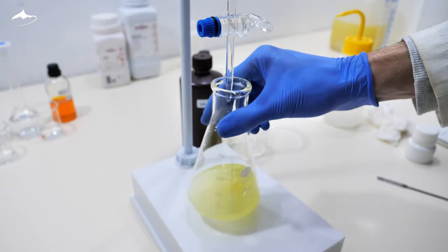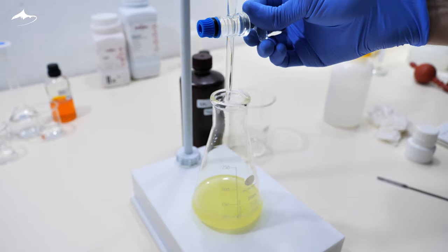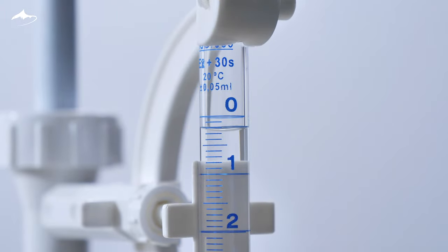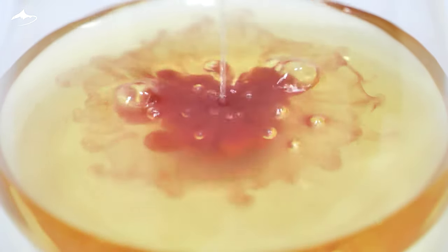As with every blank solution, little to no analyte should be present in it so additions of titrant were done drop by drop. 0.3 milliliters were used, which is something to consider. Once the experimental part is finished, the concentration of chloride can be calculated.